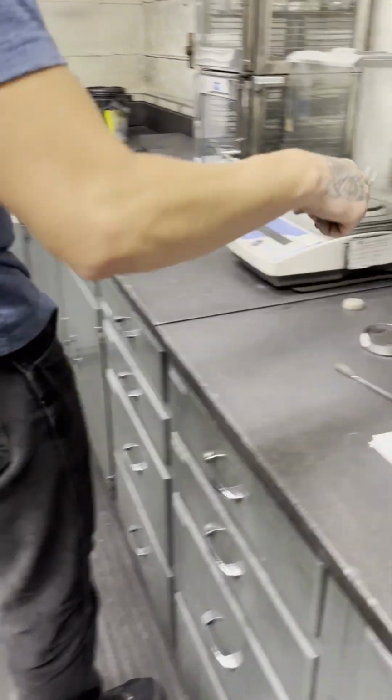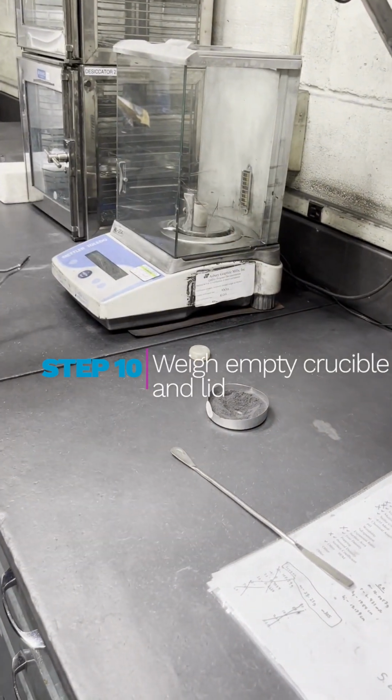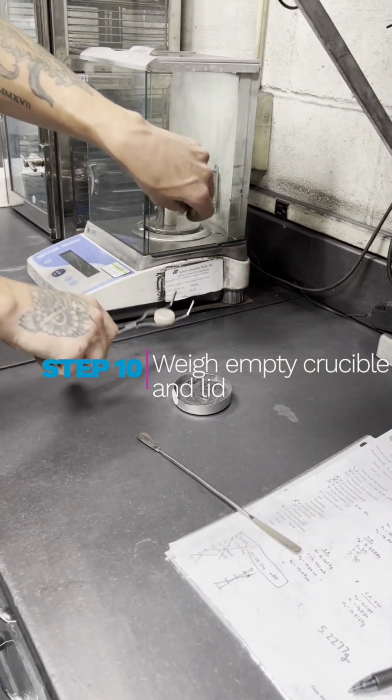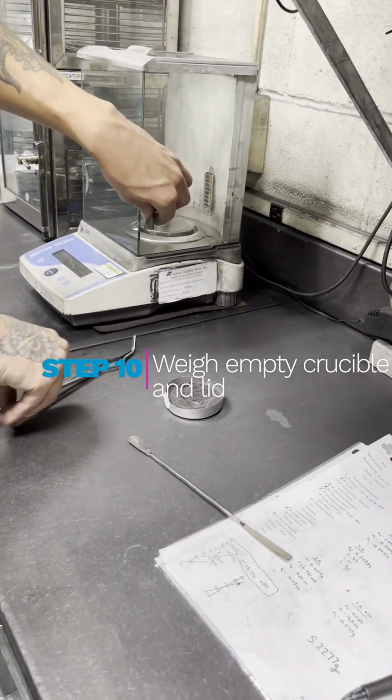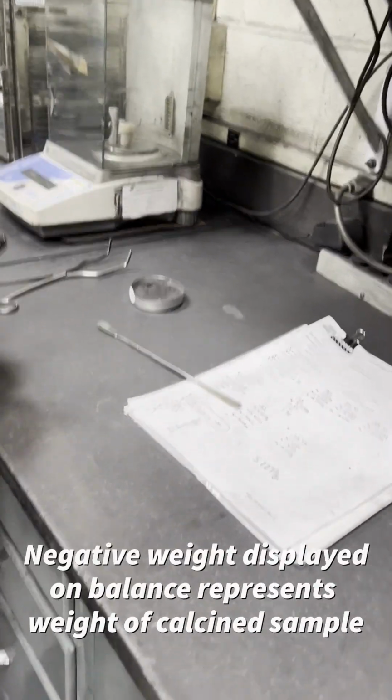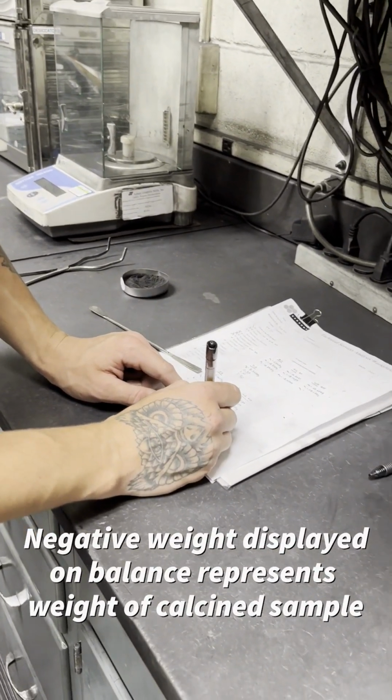Okay, once we verify all the material is out of the crucible, we're going to put it back on the balance with the lid on it. Now we're going to write this weight down, and this is going to be our calcined sample weight.